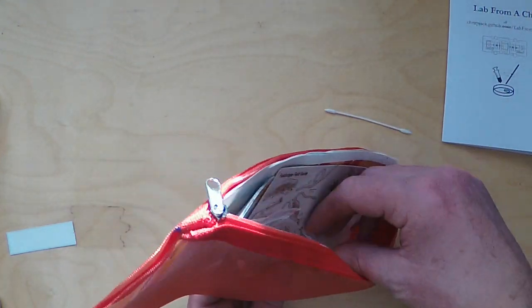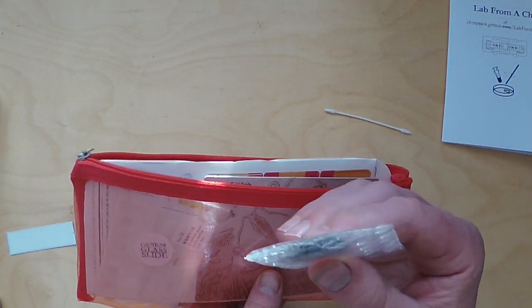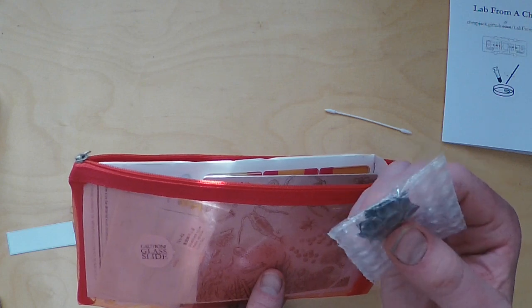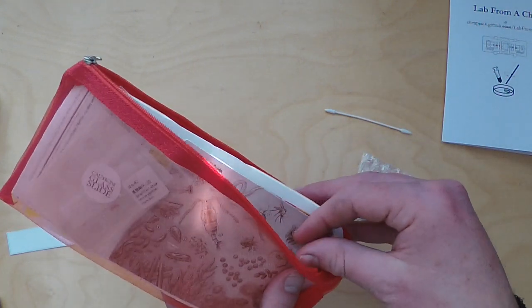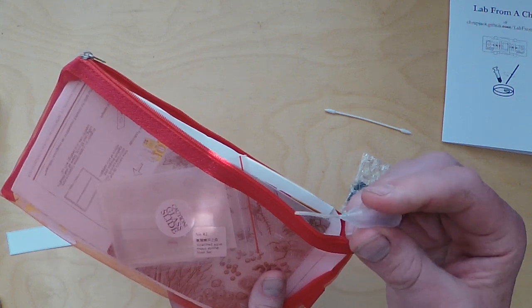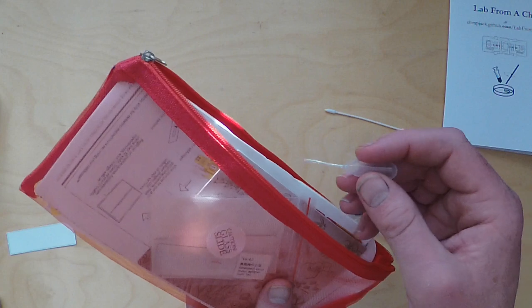There's a tiny bubble-wrapped bag and this is the lens coupler assembly, so this is where your actual ball lens lives and I'll go through those in a minute. There's also a tiny little hand pipette for taking out tiny drops of our algal solution and dropping that on the slide so we can view the algae under the microscope later.